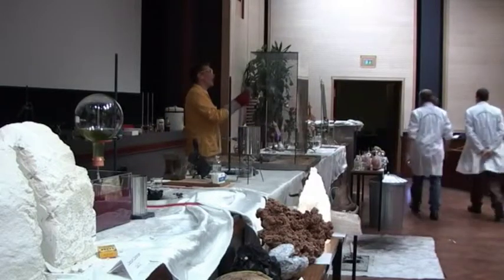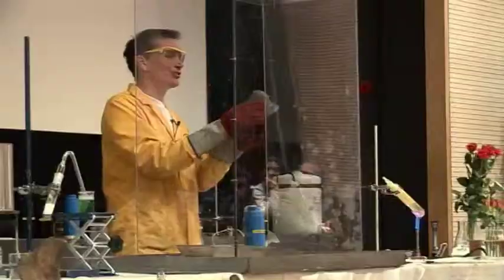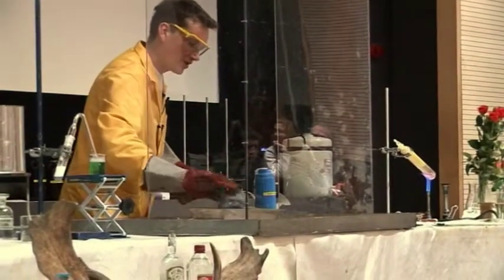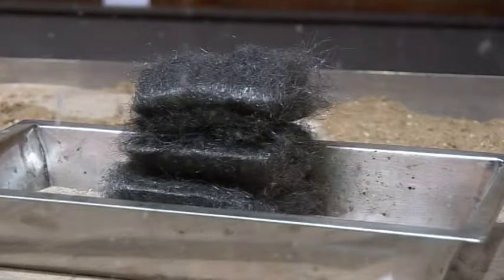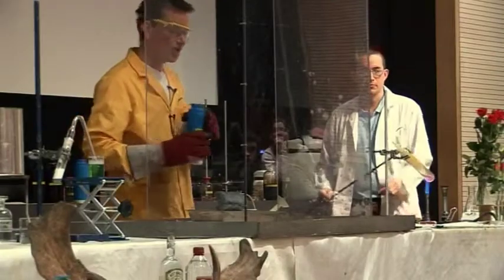So here is some iron wool — the sort of thing that you might use to clean your pots and pans. I've put the iron wool in there, and I'm going to add some concentrated oxygen. This is liquid oxygen.